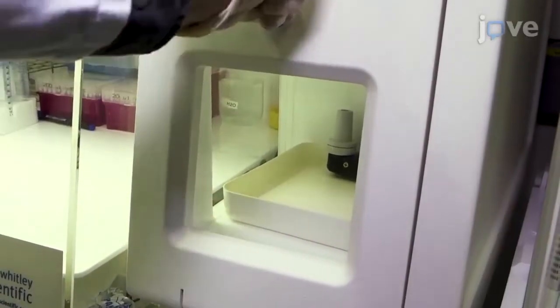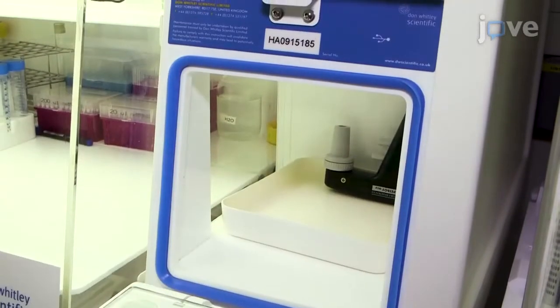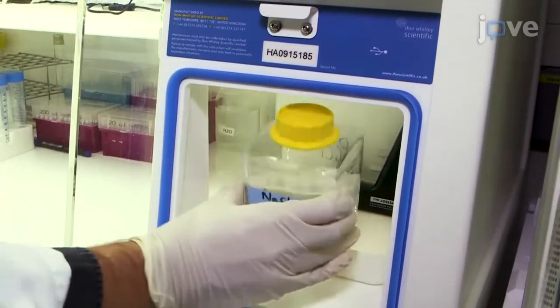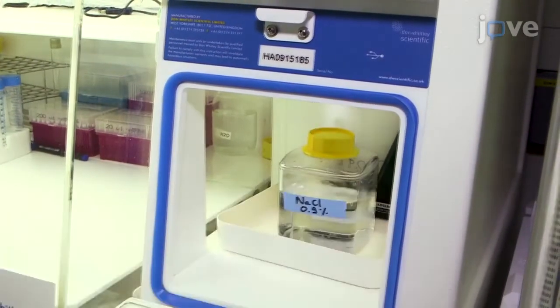To begin, prepare solutions 1, 2, and 3 according to the text protocol and place them in an anoxic cabinet overnight.